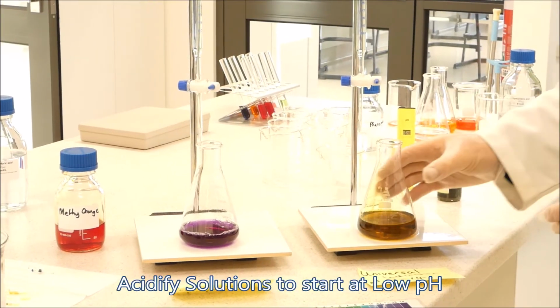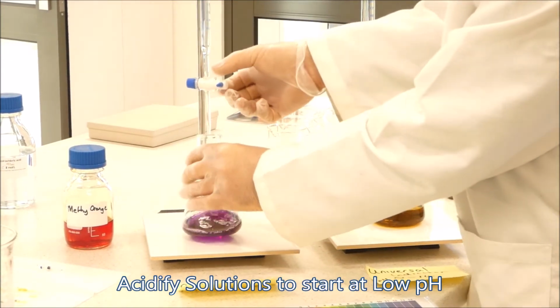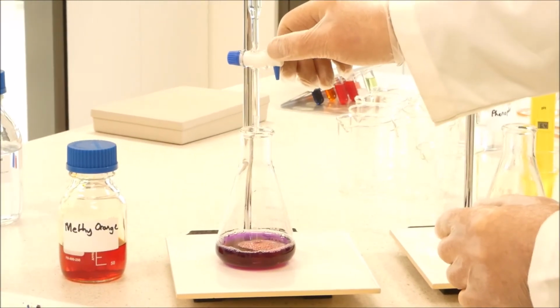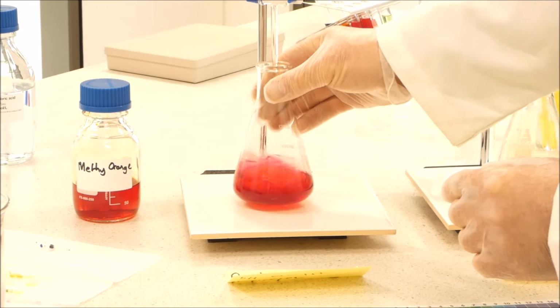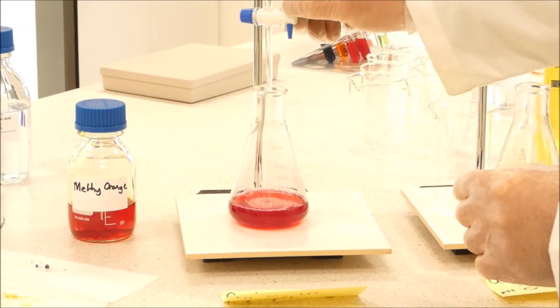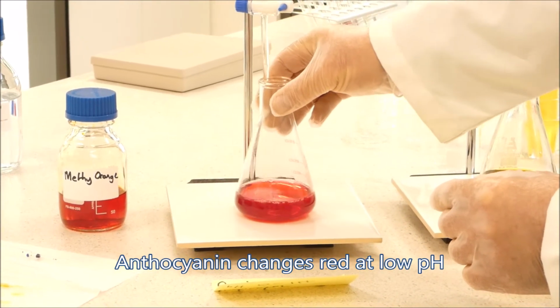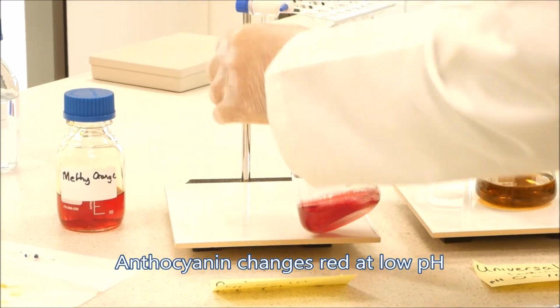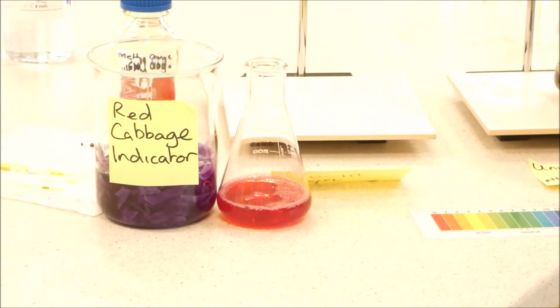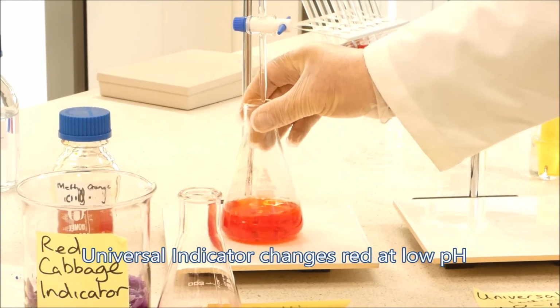What we're going to do is acidify both of these solutions to start off with. So we'll go over here and we'll place a fair bit of acid into the solution. And we'll give it a swirl. You can see it changing to a nice sort of maroony colour. We'll go a little bit more. I think that's about as much colour change we'll get with the red cabbage indicator. So we'll just put those two together so we know they're together. And we'll do the same with the universal indicator. We'll give it a swirl and it goes to a nice pink-red colour.